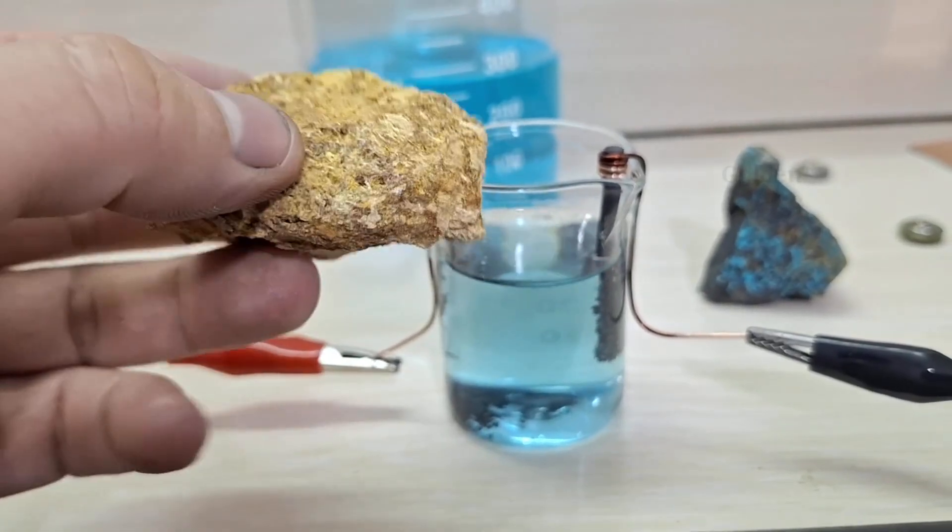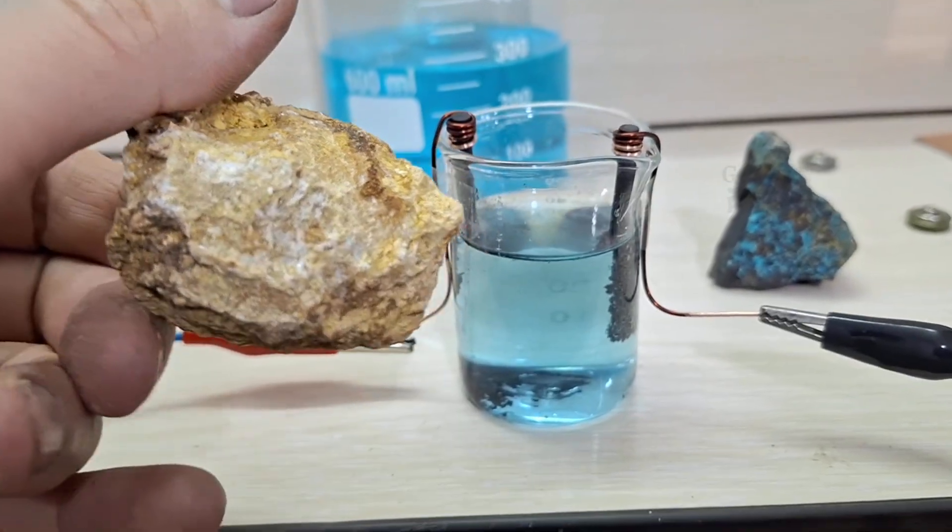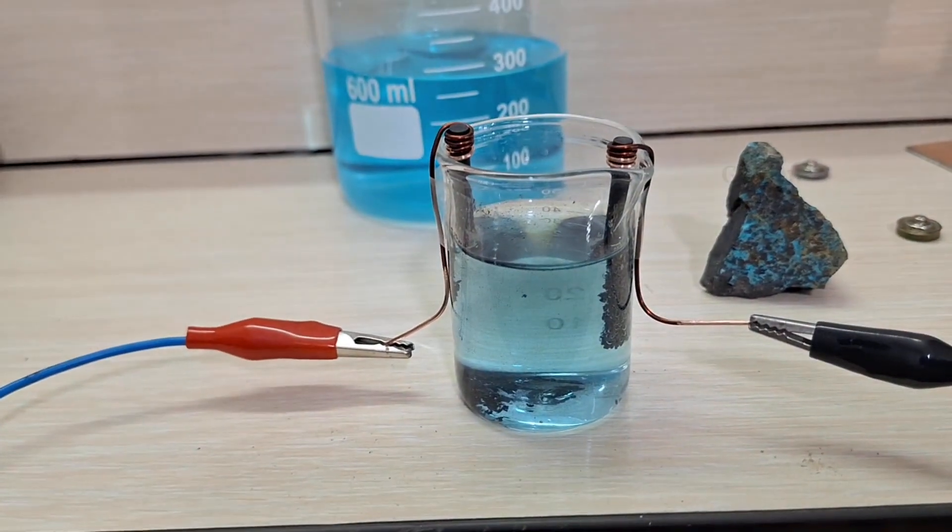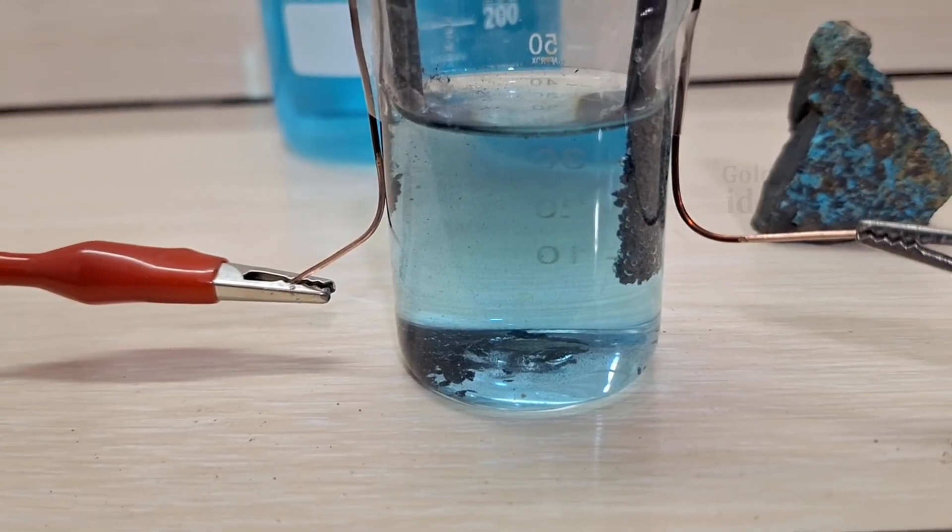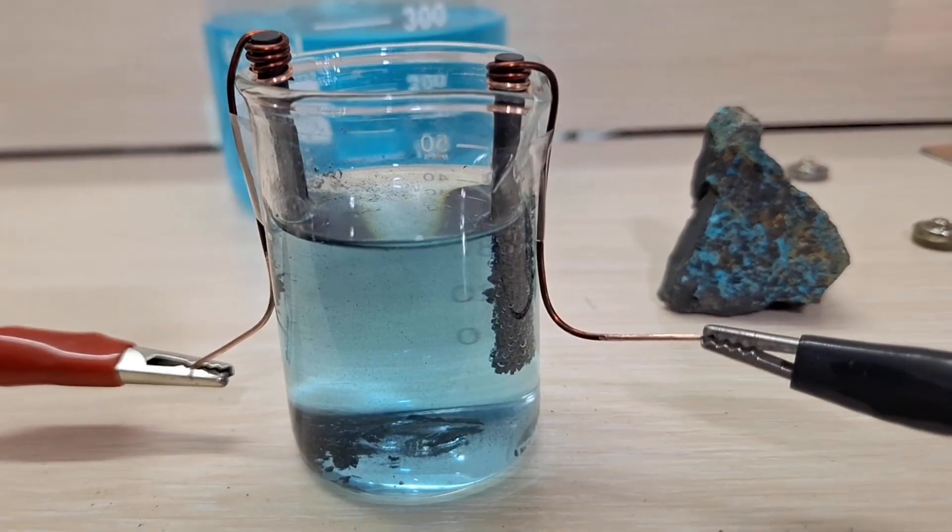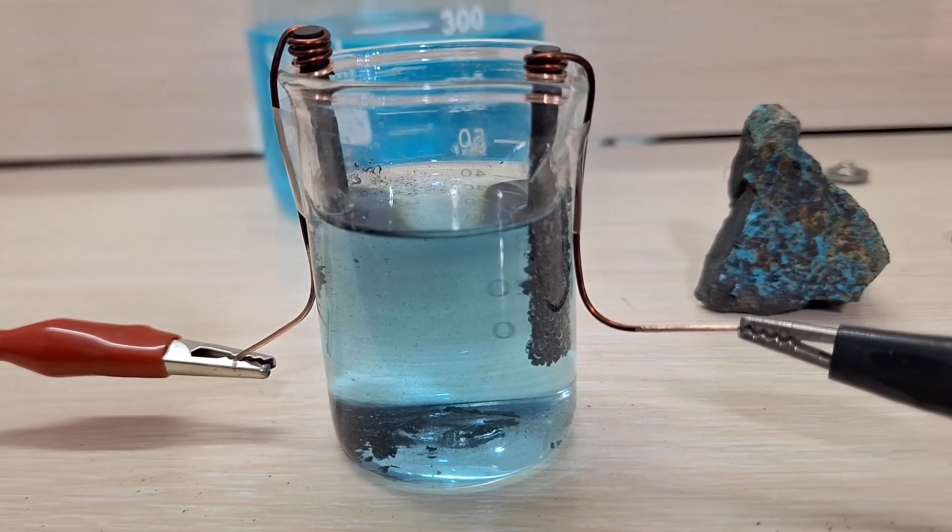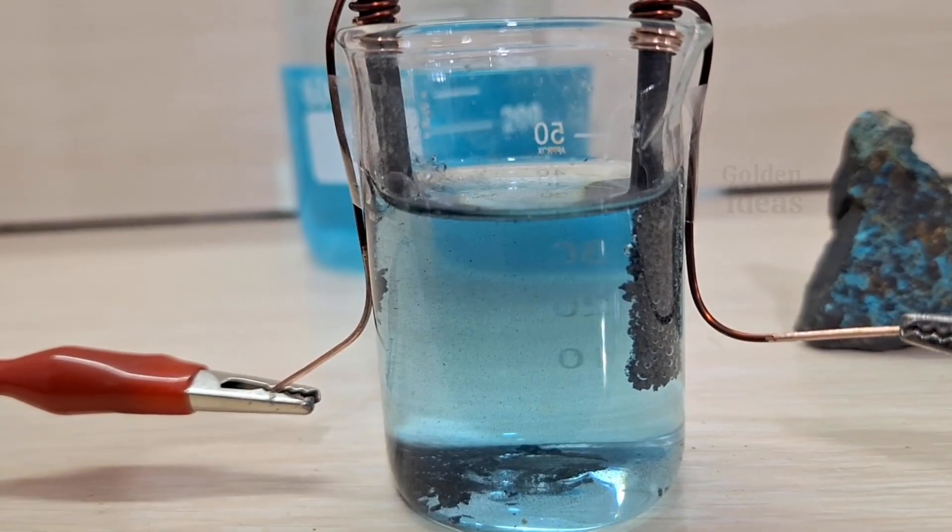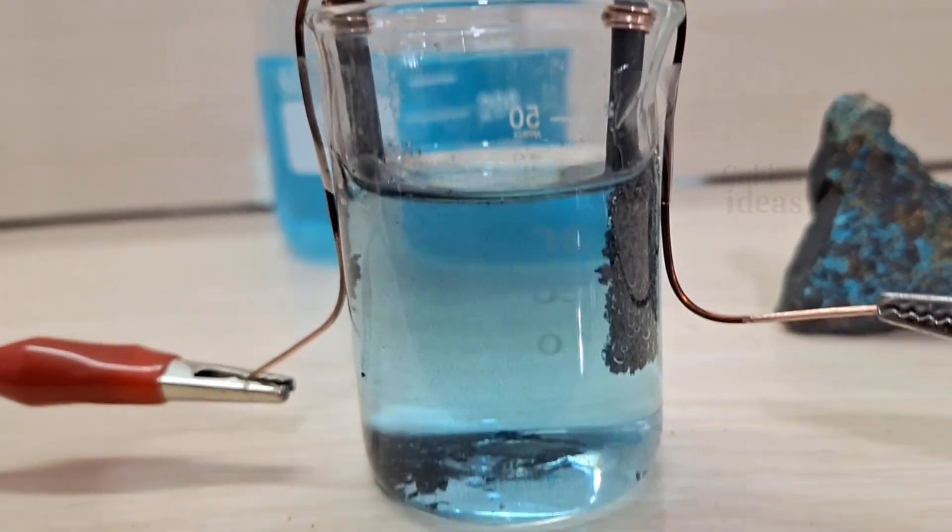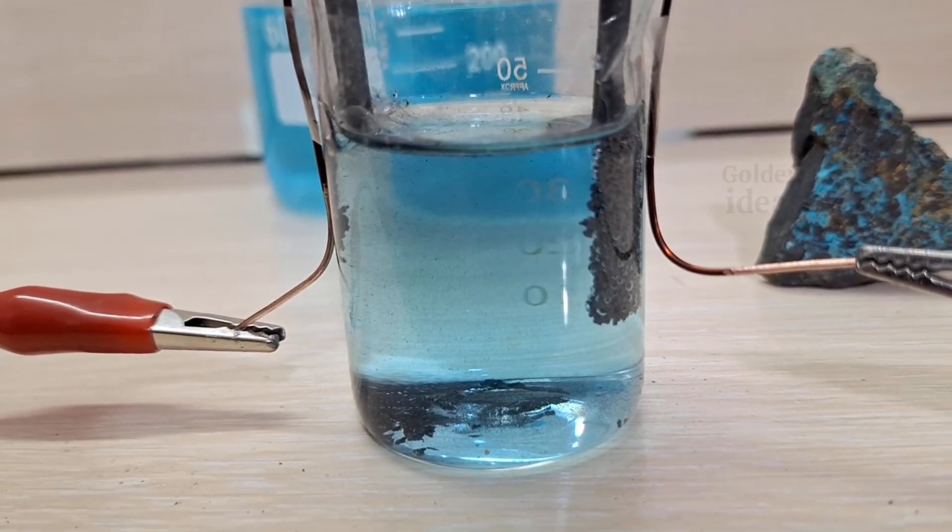The simplest method is to use copper sulfate, without nitrates. It works well both in acidic and alkaline solutions. Let me explain with a simple example. Right here in this large beaker on the table, we have a chloride solution containing gold, copper, and silver. Now, if we just add sulfur to this solution, nothing much will happen.